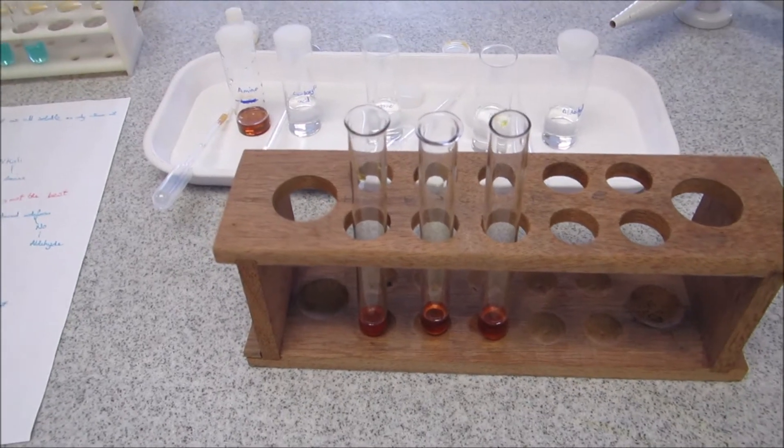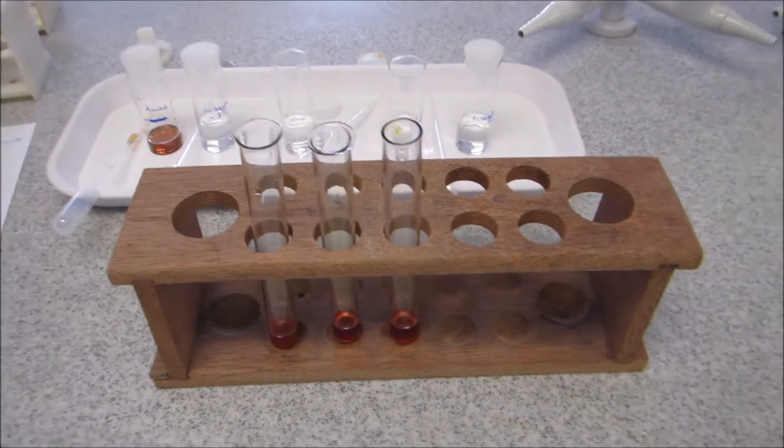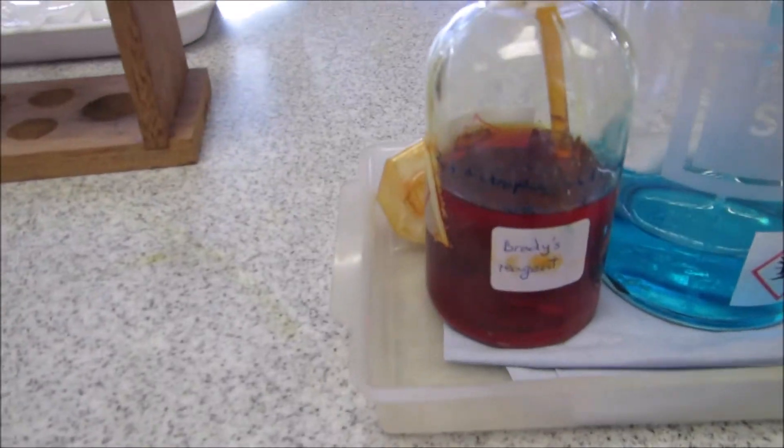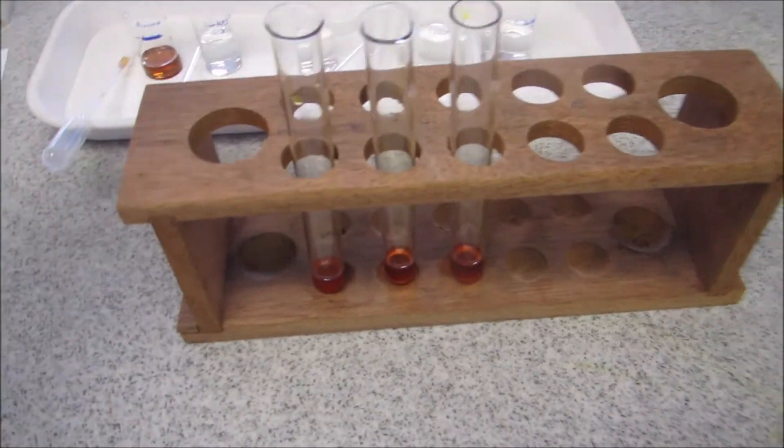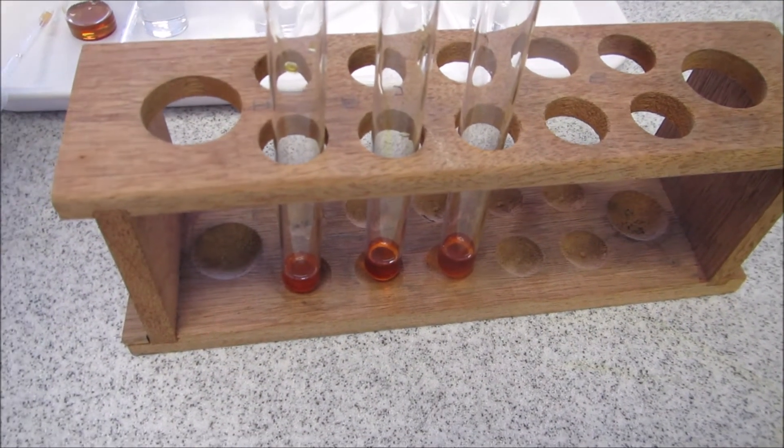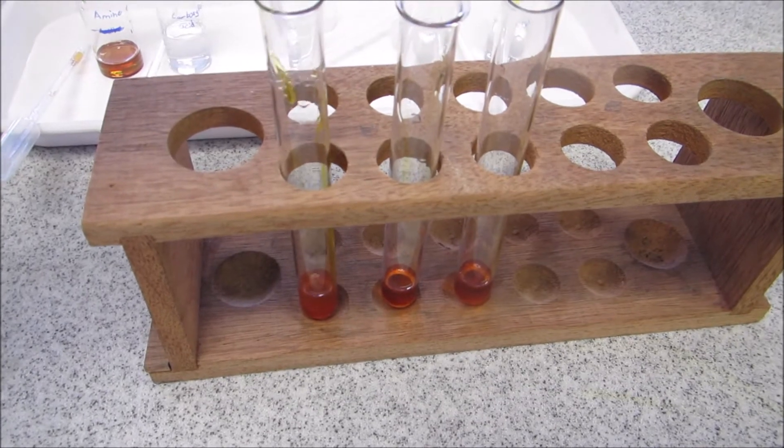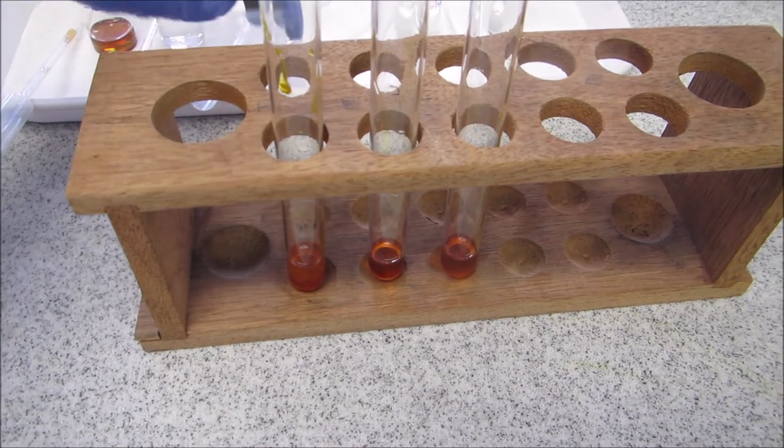So the first test that we're going to perform on the ketone, alcohol and aldehyde is to add it to some Brady's reagent. So I've already put some Brady's reagent in the test tube, and then I'm just going to add a bit of the ketone to the first one. So what did you observe? Is there any reaction?